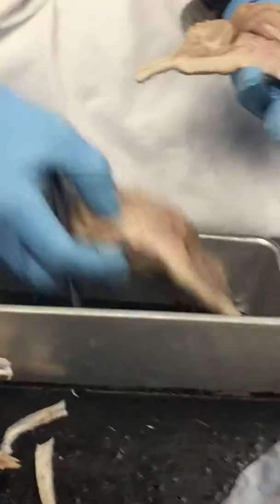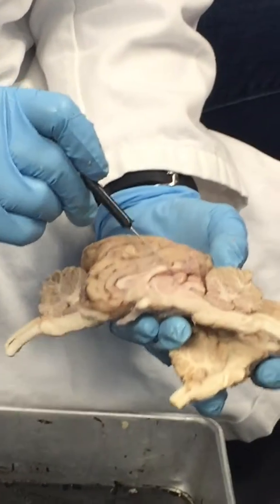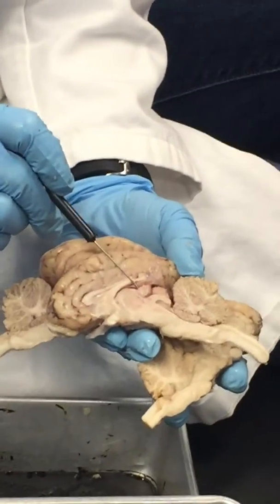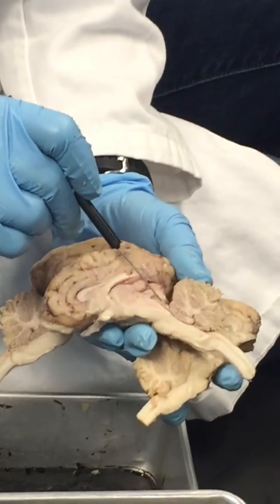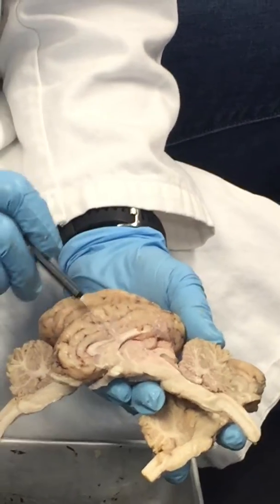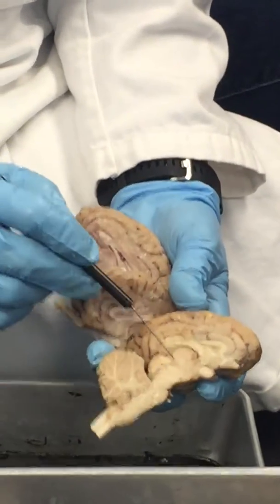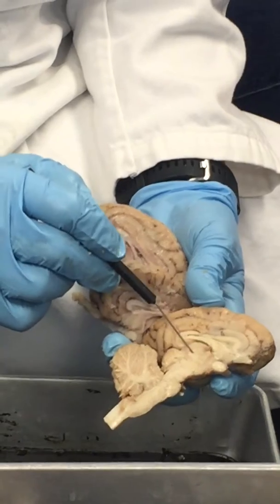Posteriorly, this one has the pineal gland, the whole thing on here, right? Here's that pineal gland right there, okay? Superior and inferior colliculi kind of fall in there. So this thalamus, this rounded area here where you can see it a little bit more clearly, that's our thalamus.